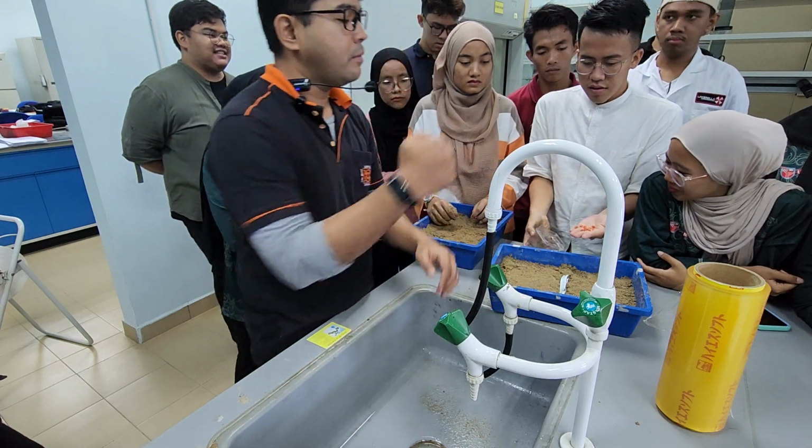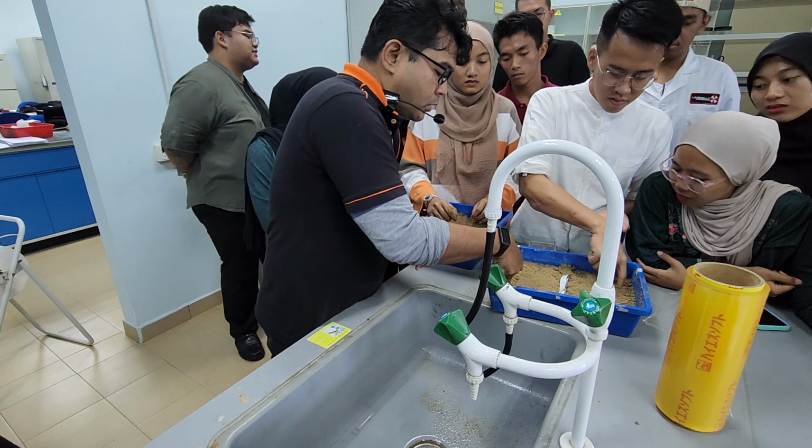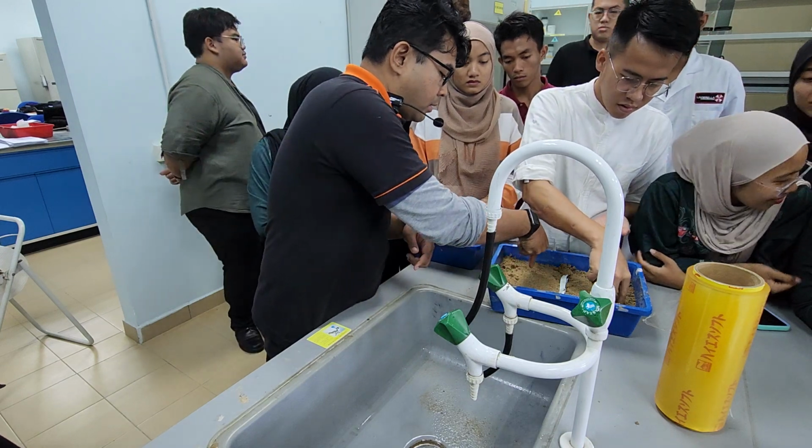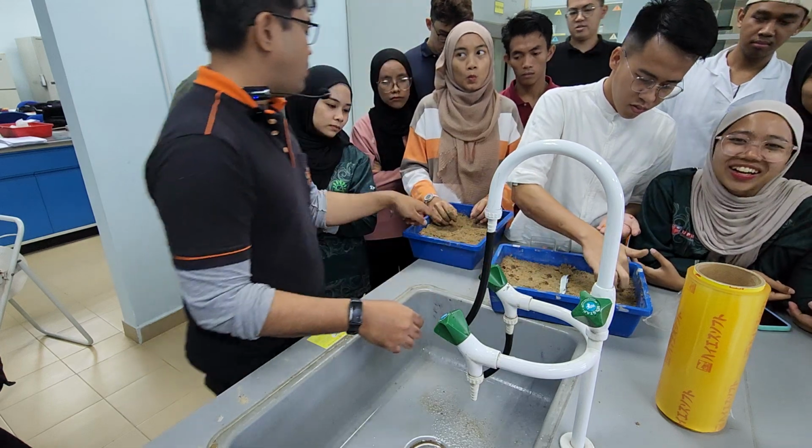31. So 15, 15, 16. Yeah, so you can use your judgment, you can use the ruler. You can do the same for this as well.